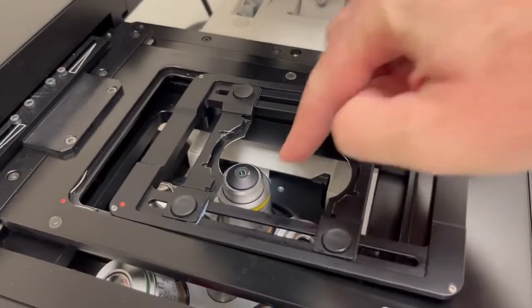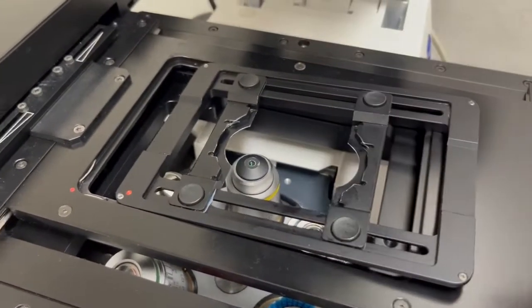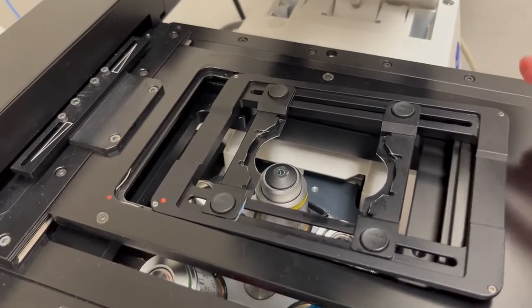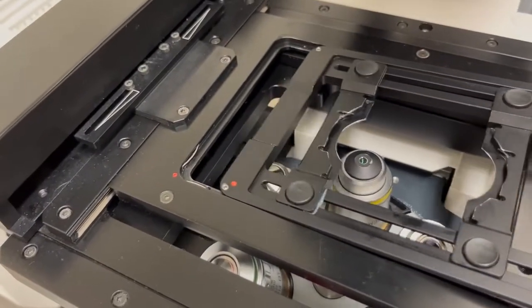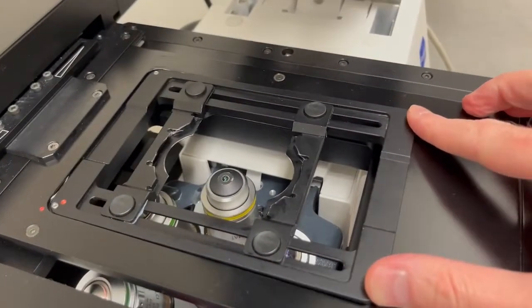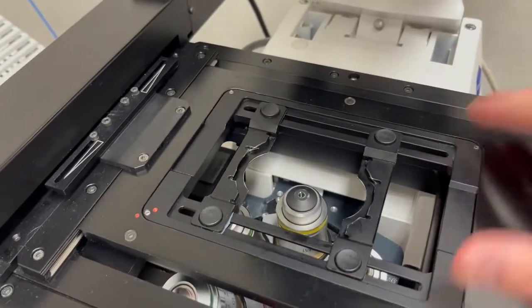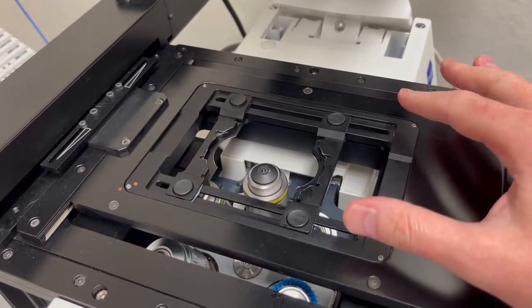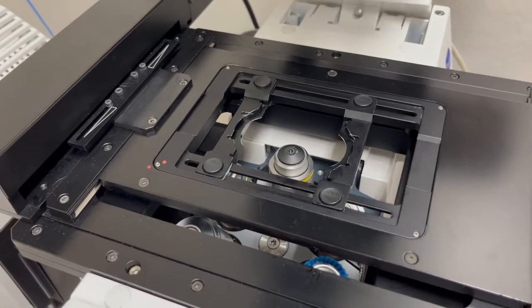And you can see it's important to have that lowered and on the 10x so that when we place it like this, it doesn't bang into the objective. And then we gently push from right to left, and that will slide this and eventually push against these two springs and lock it into position. So I'm going to do that and then make sure that it is all the way at the bottom. With that, we now know that the sample holder is properly in place and we can put on our sample.